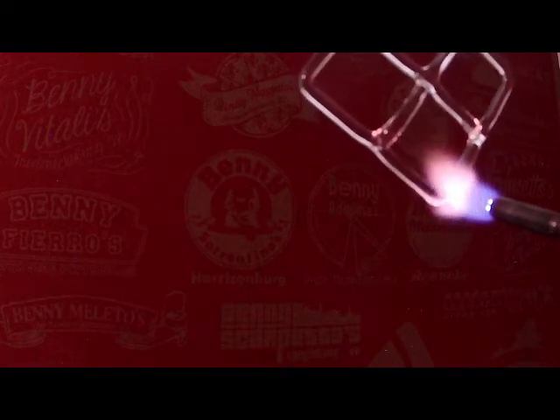This seal on the lower right corner needs some work. It's not very good. I could pull off a little blob of that glass right there, but I'm just going to work that in. And one of the things I find is that having a second pair of tweezers can be very useful in this type of situation.